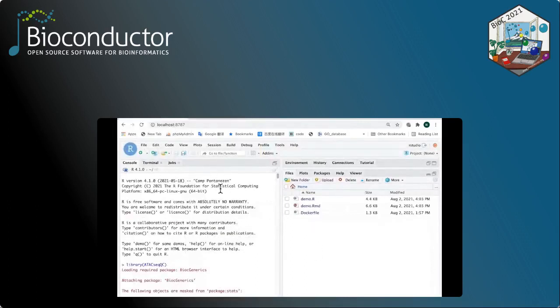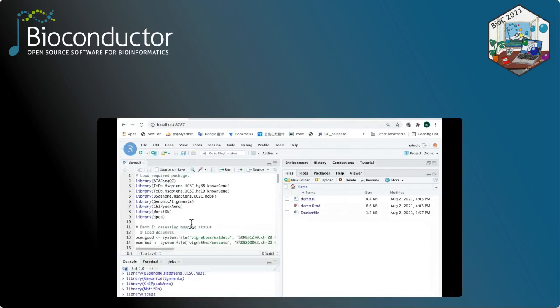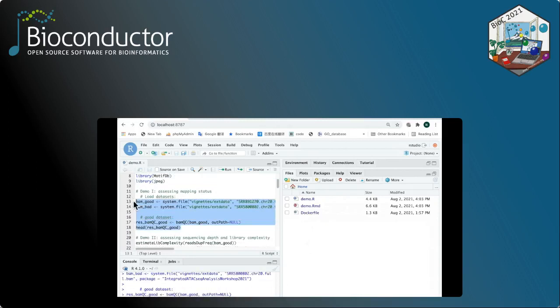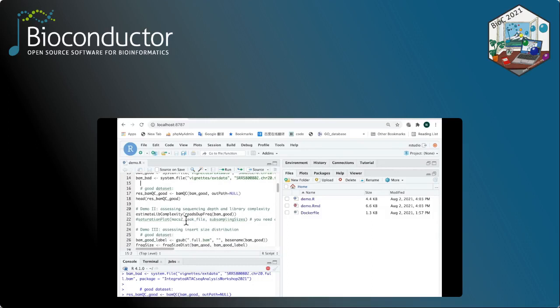So for the demonstration, first you have to open the demo.r file by clicking this. And first you have to load all the packages into the memory. And after that, for demonstration 1, we're going to use the function called BAMQC to evaluate the quality of the BAM file. To this end, first you have to specify the path to the BAM file, and then feed these BAM files into the BAMQC function. This function may take a little bit longer to run, especially when the BAM file is big. We just have to be patient. And after several seconds, you will see the results from the console, as shown here.